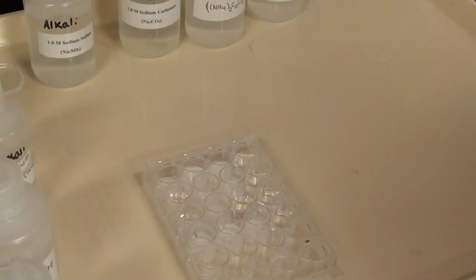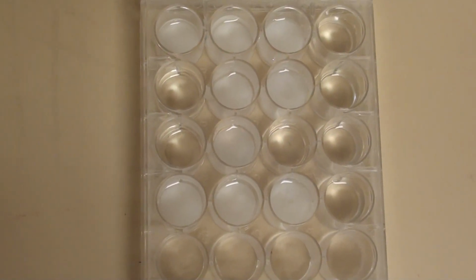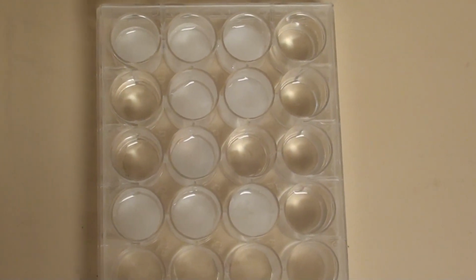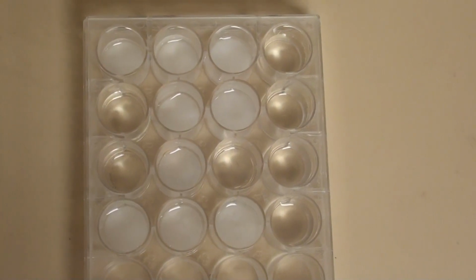All right, excellent. So I'm going to show what these look like here, and you can get an impression of what's formed precipitates and what hasn't. And you'll have your unknown there, and you'll be able to compare your unknown. You can see that none of the results are exactly the same. They've all given something that's just a little bit different in each of these cases.